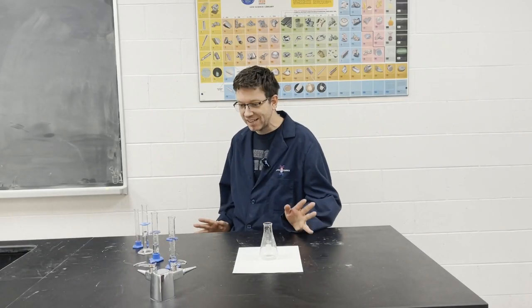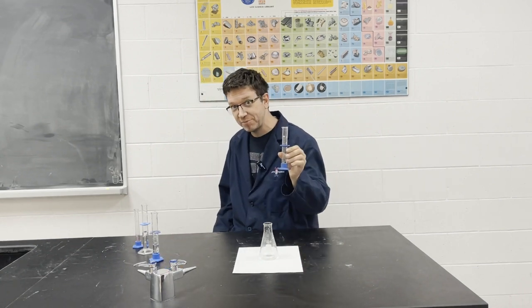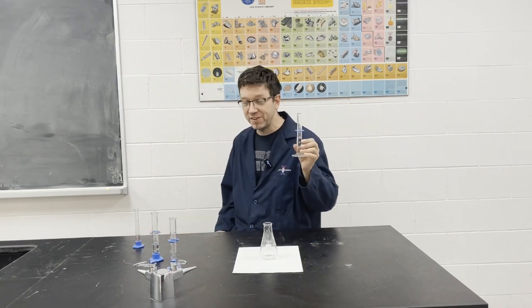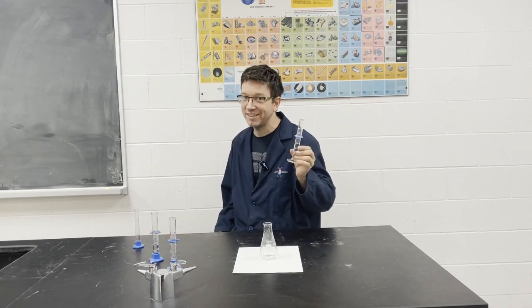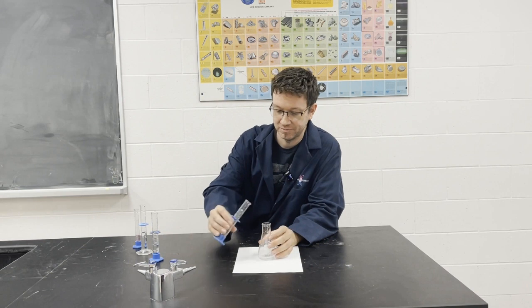And finally, to test a lower concentration of sulfuric acid, we have 5 milliliters instead of 10. And then we put 15 milliliters of distilled water instead of 10. So let's test the rate of reaction for a lower concentration.